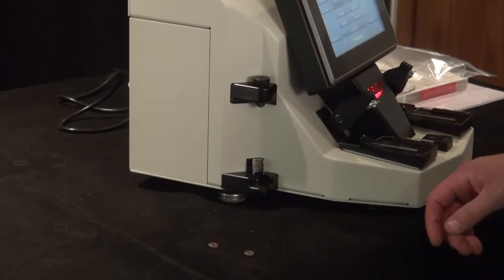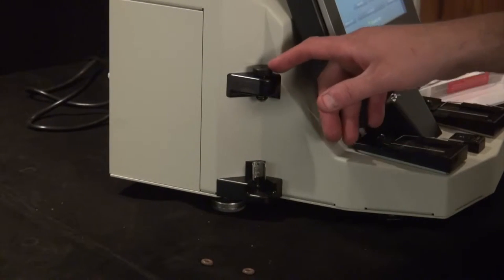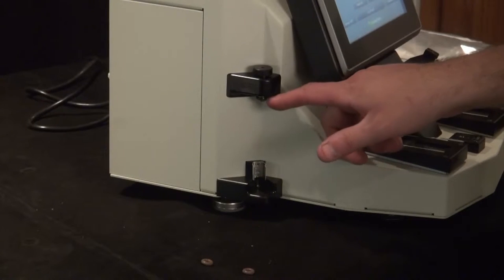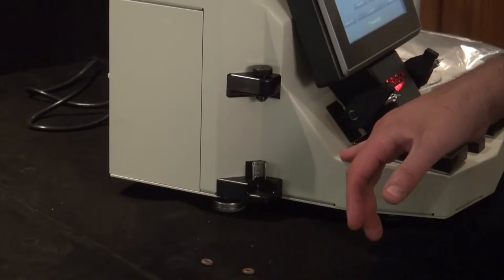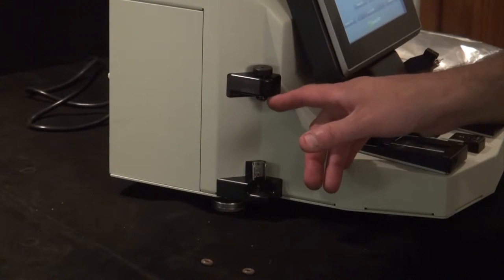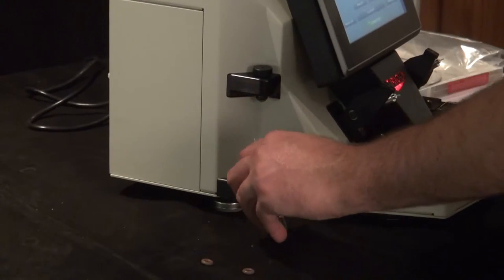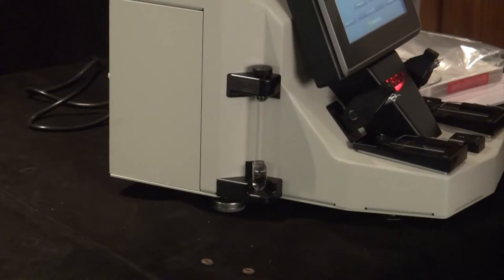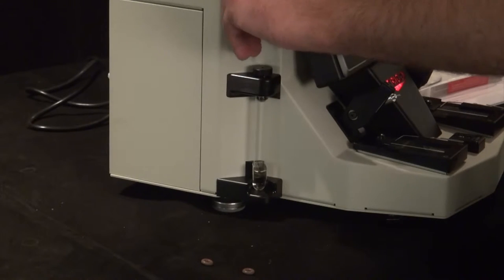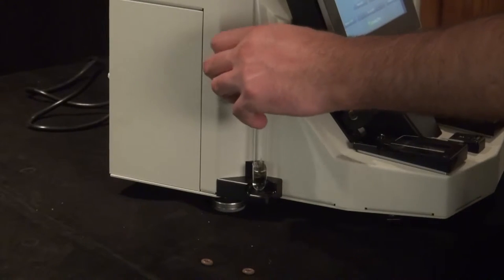The section we're going to talk about is replacing the vial sample seals. There is a lower seal and an upper seal inside the cap, and then here on the little nipple that protrudes off the top block. The reason you want to replace that is when you insert the vial repeatedly over and over again, it wears on the O-ring at the top. Same goes for the sample tube that goes into the unit through the top portion here. It slides past the O-ring, so that wears, and those are a replaceable part.